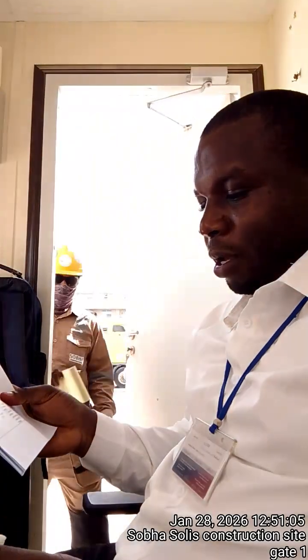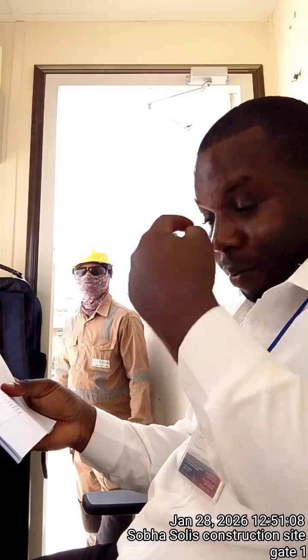I'm going to handle question number 1, in which I'm required to test for the presence of common ions using simple qualitative tests. First I'm testing for carbonate ions, and I'm going to use vinegar. If you have access to dilute hydrochloric acid, you can use that. Sorry about that, members are at work, that's why you see people coming in, but don't worry. For me, I'm going to use acetic acid because it's locally available. I purchased it from the supermarket.